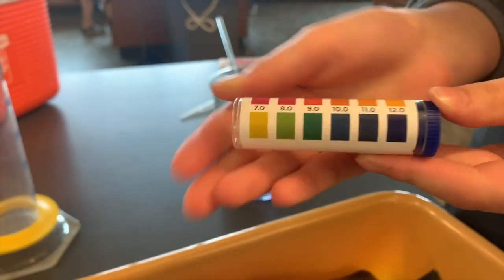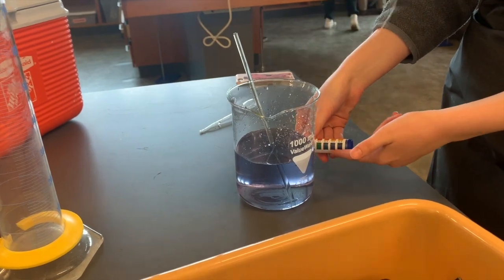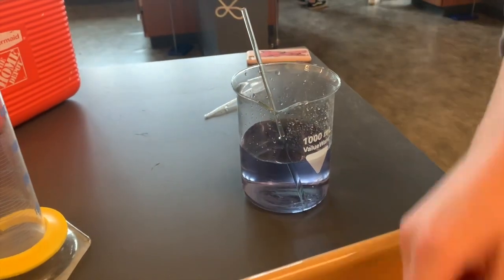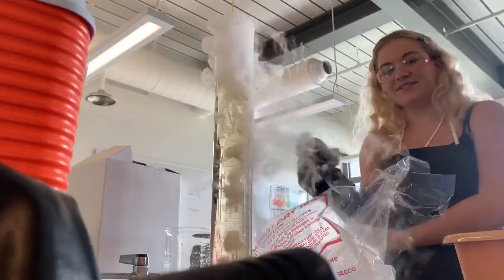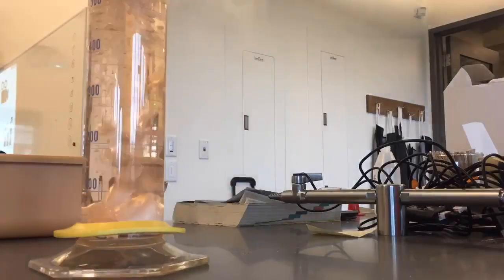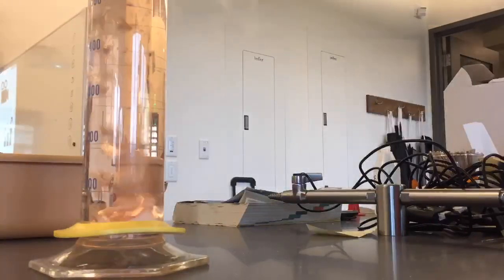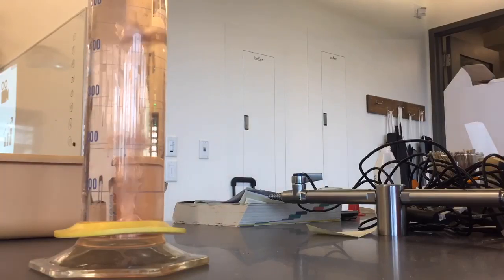In our experiment, we start with the dark purple color. Checking our key, we see that this indicates a pH of 11. This must be right because we have added basic sodium hydroxide to the water, and a pH of 11 is basic. Now, when we add the dry ice, the color starts to change, meaning the pH is changing. If we follow along with our reference sheet, we see that the pH is getting lower and lower, meaning the liquid is becoming more and more acidic.